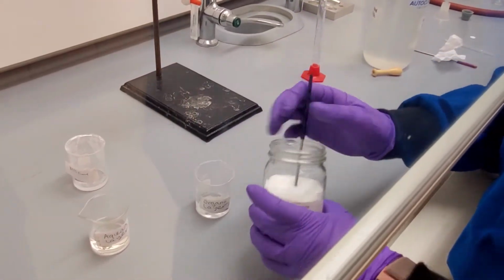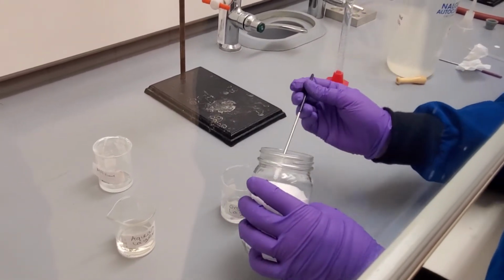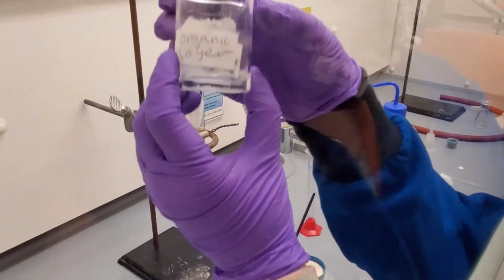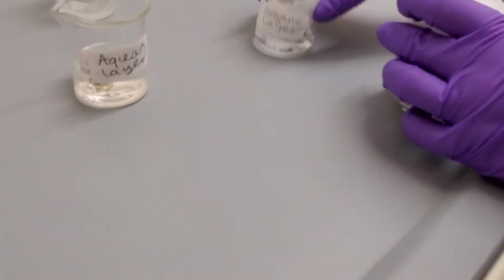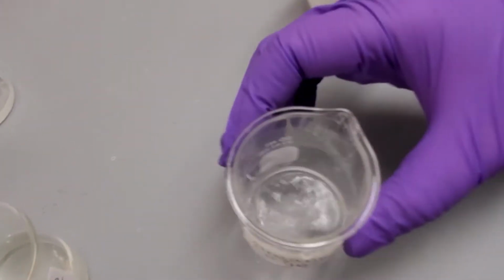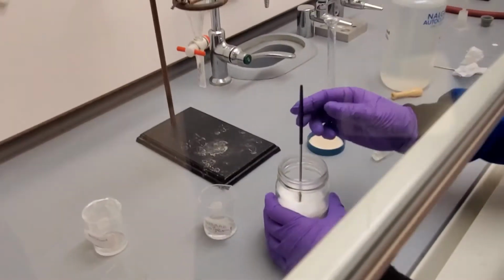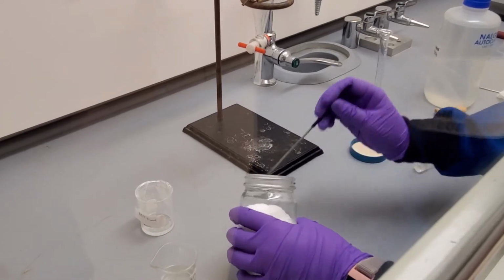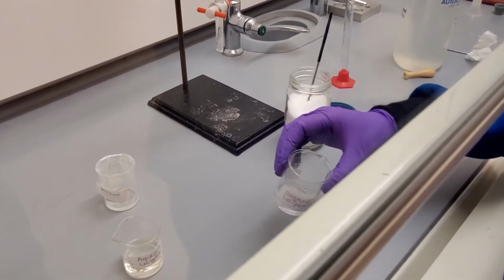In order to remove any remaining water molecules in the ethereal layer, we add a few scoops of sodium sulfate into the organic layer beaker. We hold the beaker at eye level and swirl. If there are only clumps, that means there is still water present in the organic layer. We need to add more scoops of sodium sulfate. Even though we can't see any water separation, there are enough water molecules dissolved in the ether layer to cause the sodium sulfate to clump.